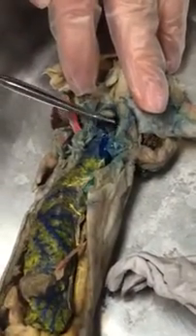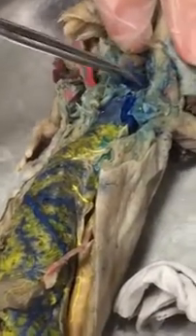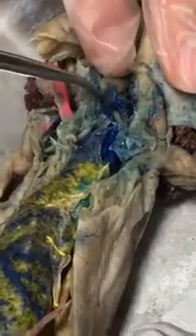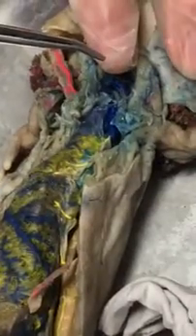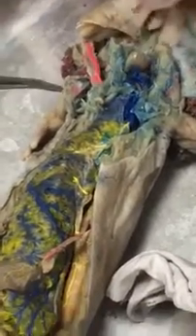And if you pull up on the ventricle, connecting to the ventricle, it's kind of triangular. That's the sinus venosus. And then going into the sinus venosus, you can see kind of like the corners of the triangle, the left and the right branch. Sorry, left and right common cardinal veins. Common cardinal veins going into the sinus venosus.